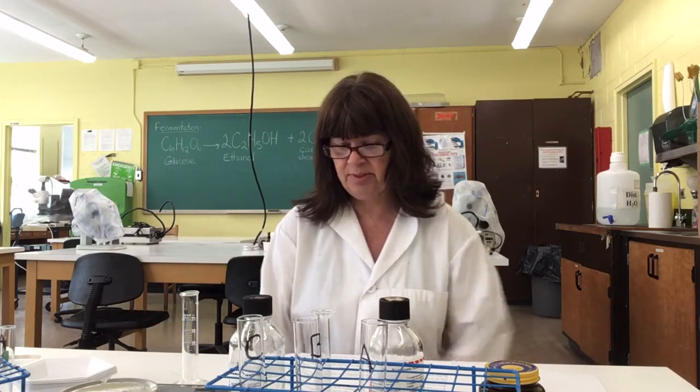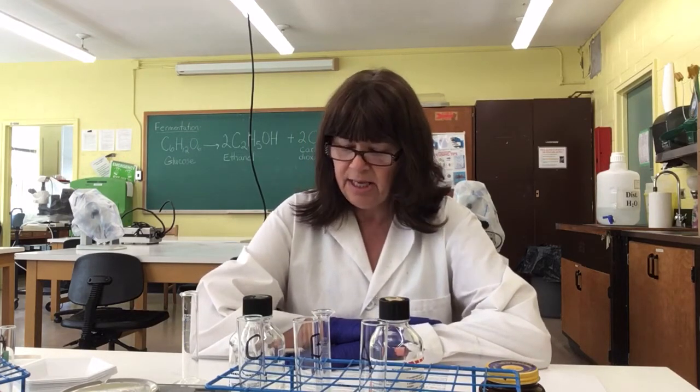Hi, my name is Valerie and I'm a lab instructor with Memorial University. In today's lab I will show you a simple experiment designed to show how and why yeast can be used in the production of leavened bread, beer, and wine because of yeast's ability to undergo fermentation.